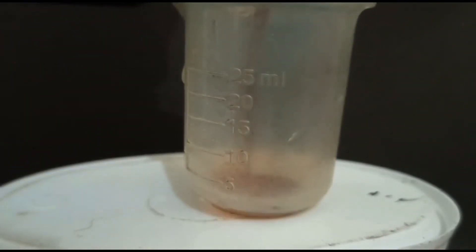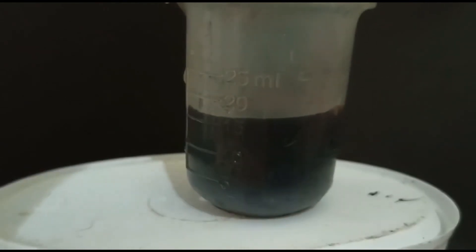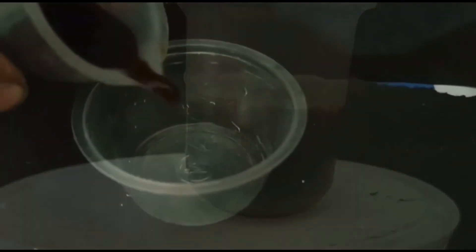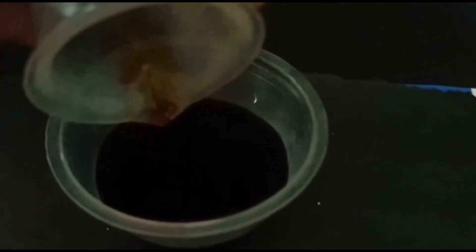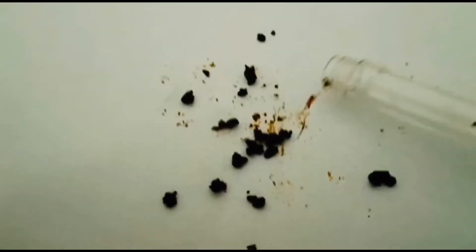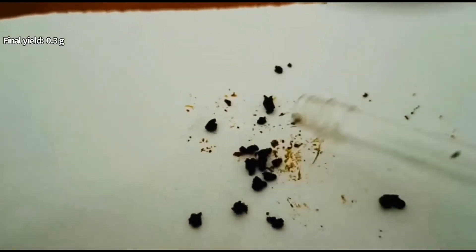I measured the volume of the solution, which is about 20 ml. Then I transferred the solution into another container and dried it in the sun for about 2 weeks. The final yield was about 0.3 grams.